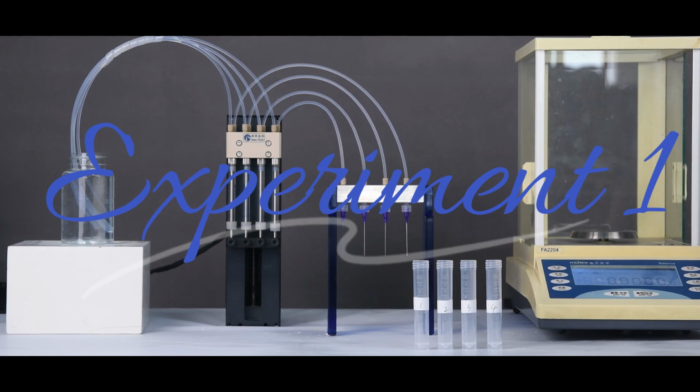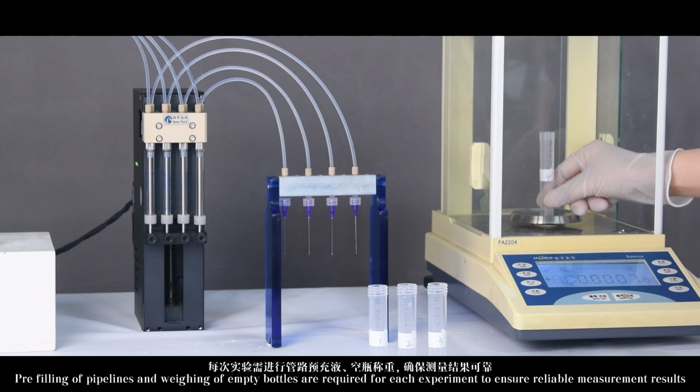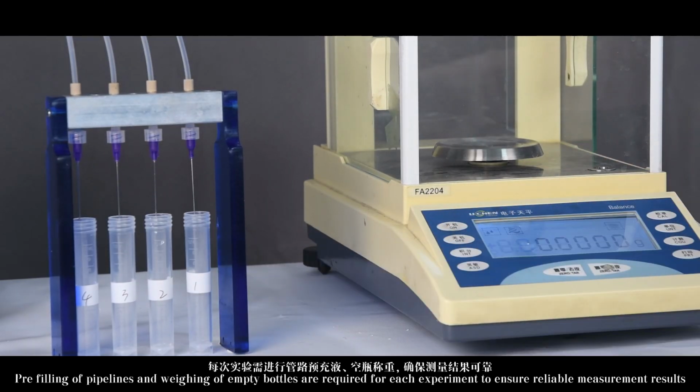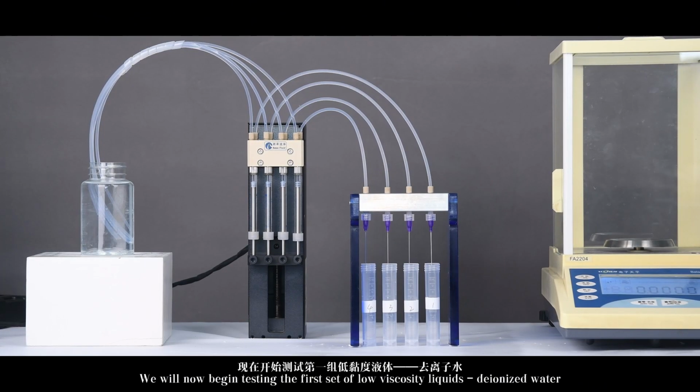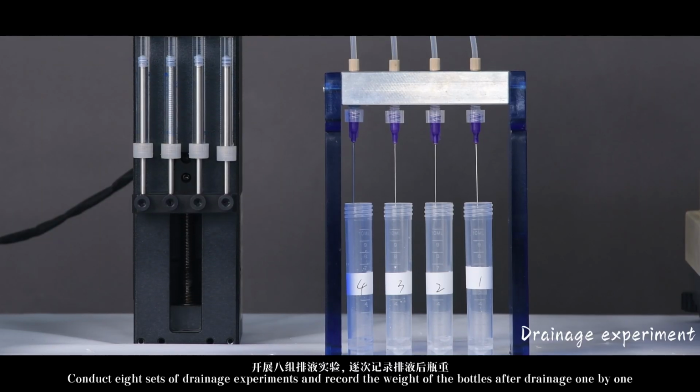Experiment 1. Pre-filling of pipelines and weighing of empty bottles are required for each experiment to ensure reliable measurement results. We will now begin testing the first set of low-viscosity liquids, deionized water. Conduct 8 sets of drainage experiments and record the weight of the bottles after drainage one by one.